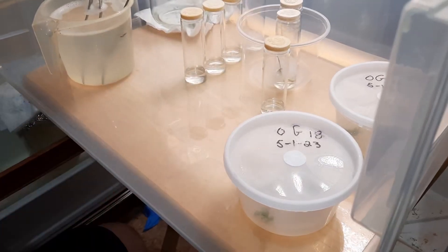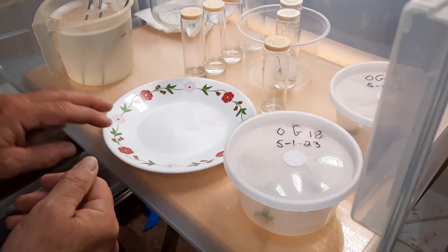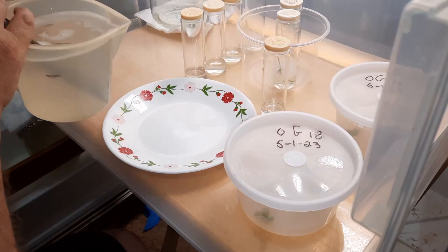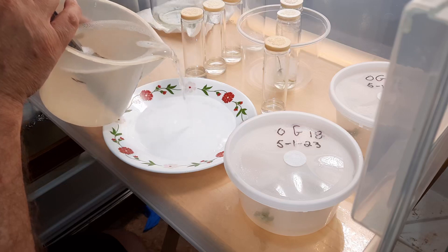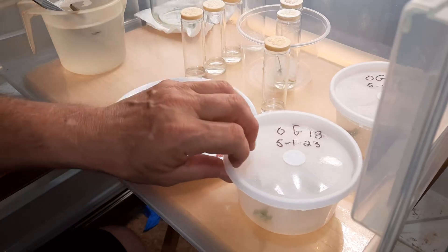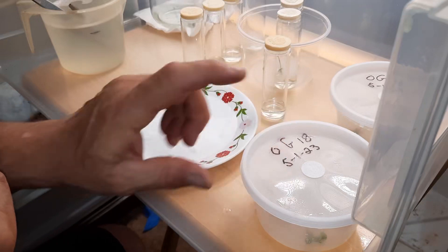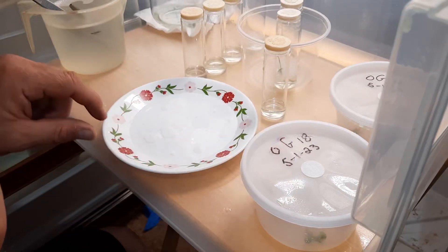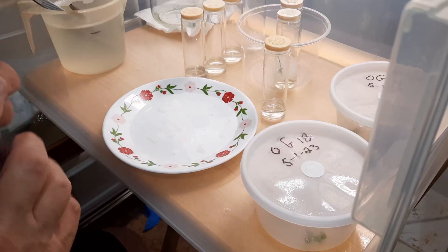I have my HEPA filter running in the background. What I'm going to do is take a little plate here, put some bleach water in it, and that's so I can trim my explants. That's what these are called — your little plants like these are called explants. The plants that I pull out of here, I'm going to put in this plate and trim off any dead leaves and excess leaves, and get them all brand new again.